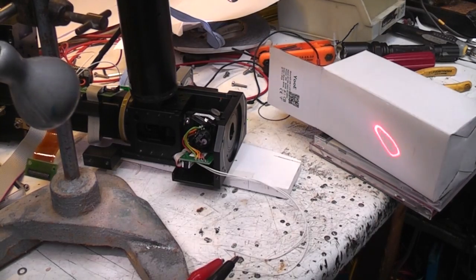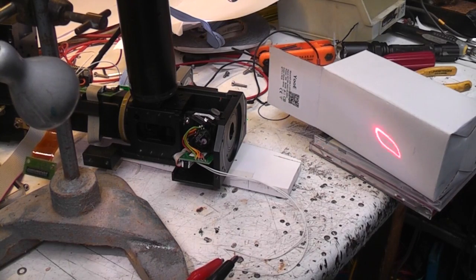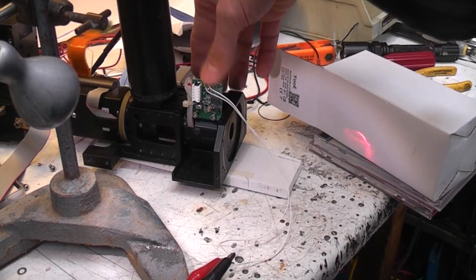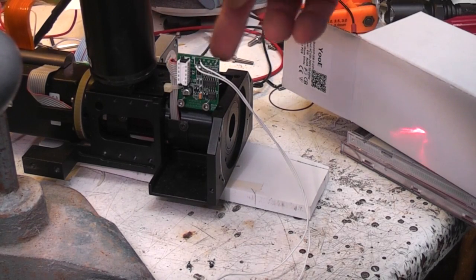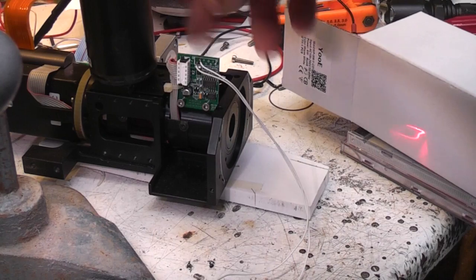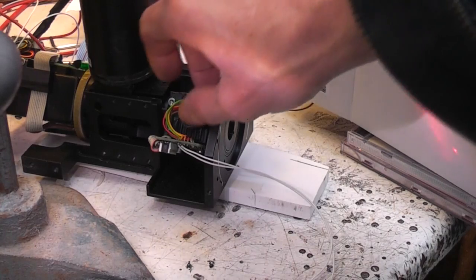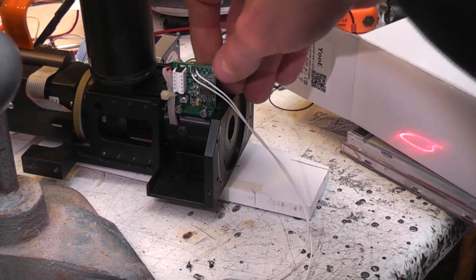These galvos do need quite a lot of control if you actually want to get accurate scanning. Things like laser displays, they've got internal optical feedback, position feedback, so you actually need to create a sort of proper servo system to actually get them to go to an accurate position. So I can change the waveform shape on here, but it's very much determined by the dynamics of the galvo. This is running at 60 Hertz. And there's the little circuit on the back of here. This is the amplifier for the feedback. So there's a photodiode and an optical arrangement in there that gives you a signal that tells you how far around it is. This little one here, it's a moving magnet, so it's basically a magnet with the coils around it. Applying signal to the coils makes the magnet move, but because of the dynamics you need to have a closed loop feedback to actually get it to move sensibly.